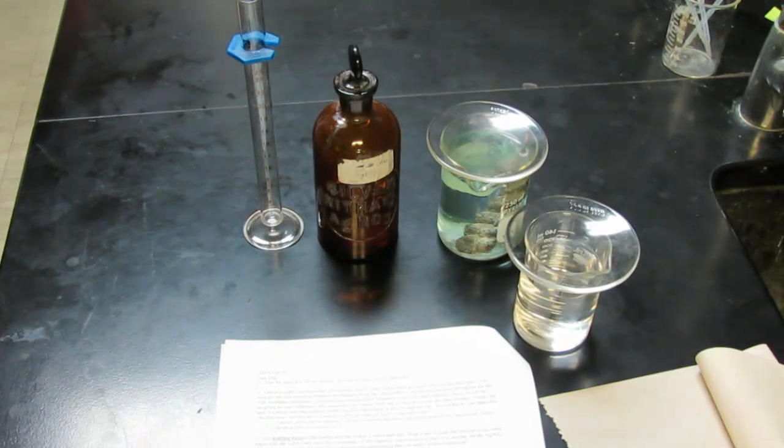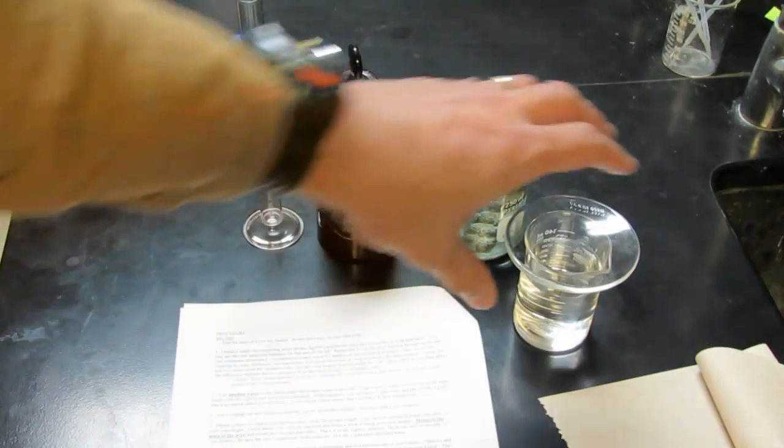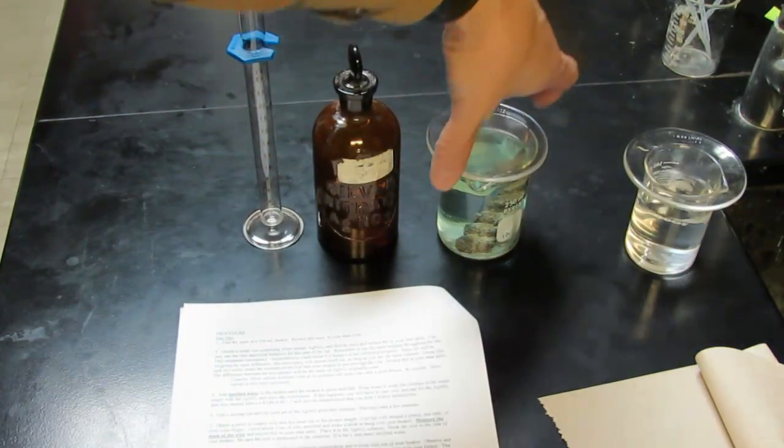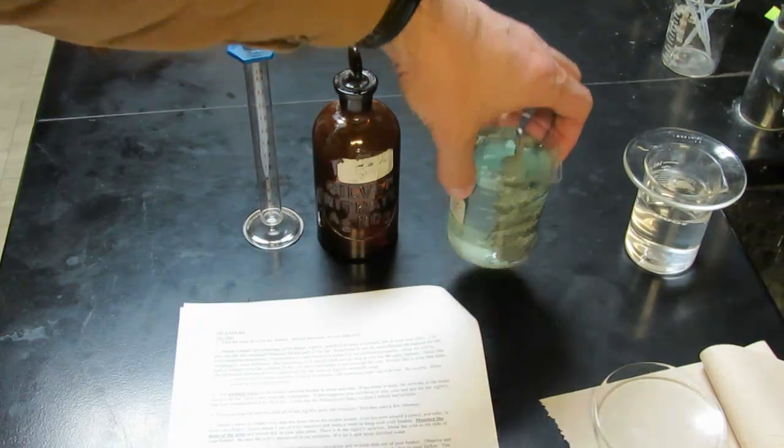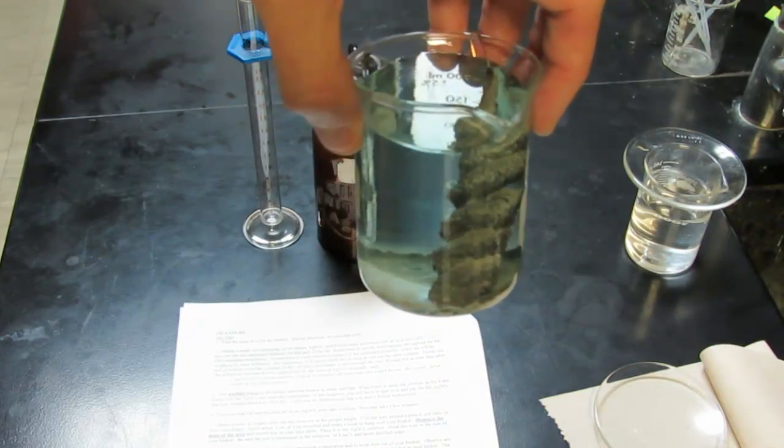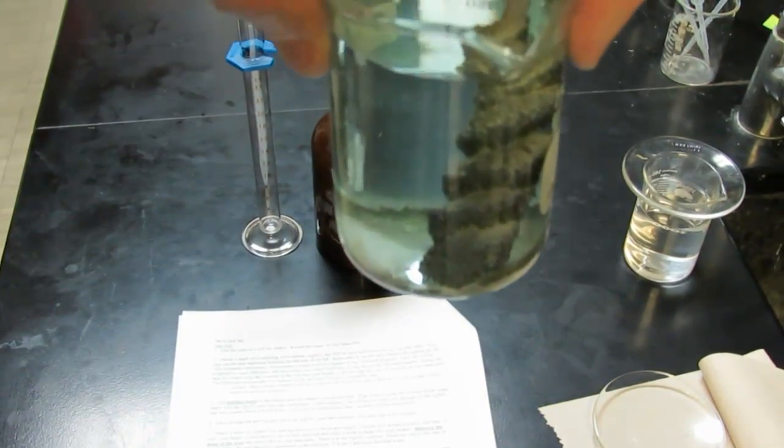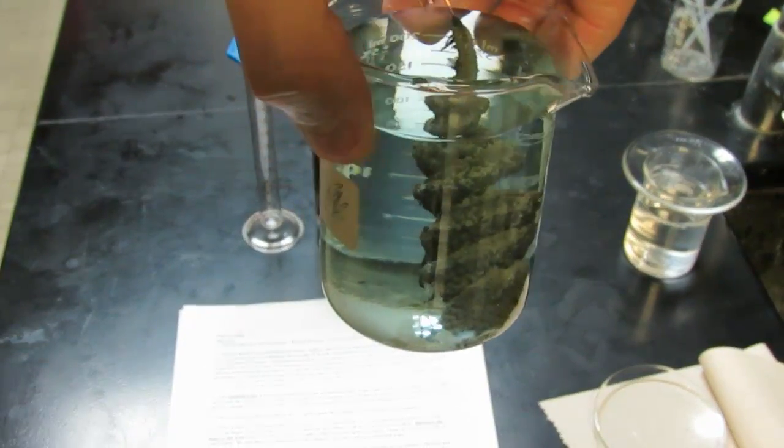We're back for day two of our silver lab, and I want you to take a minute and take a look at your reaction that occurred inside your beaker. You can see that we have quite a bit of silver that's deposited on our copper wire.